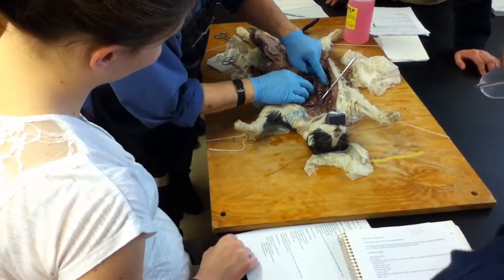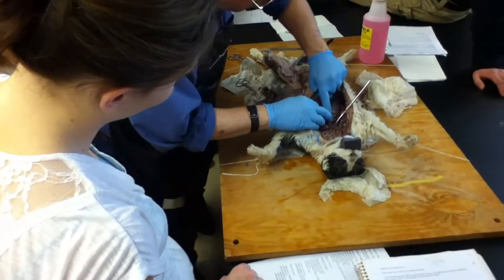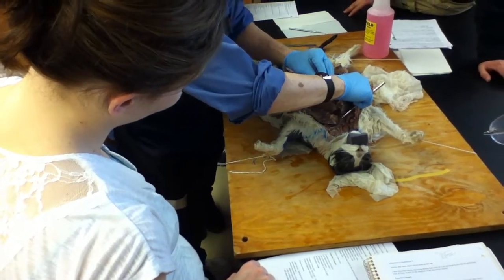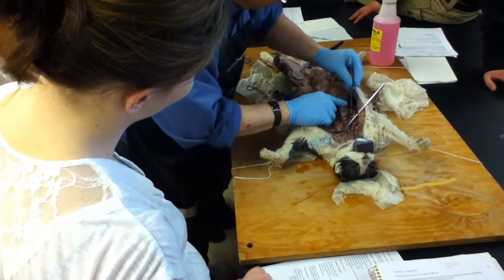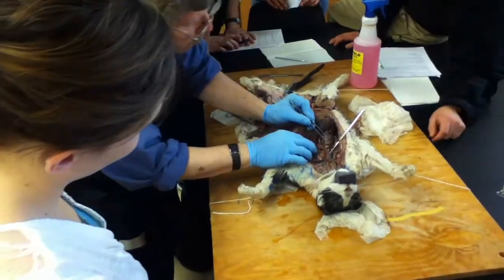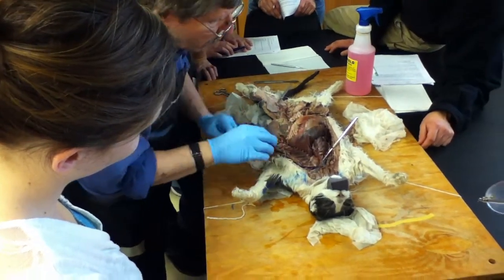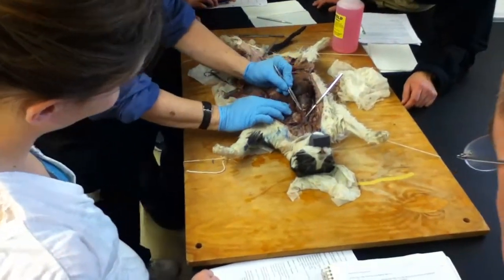Now we can see underlying ventricles for the most part. And atria. Okay, does everybody recognize that? And so basically you see, so you see a major vessel right here. This major vessel would be what?